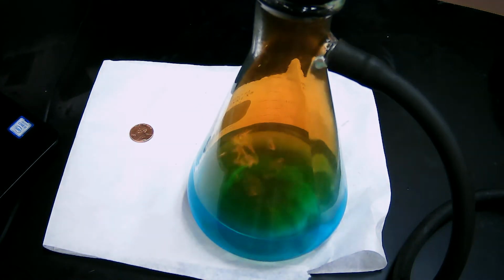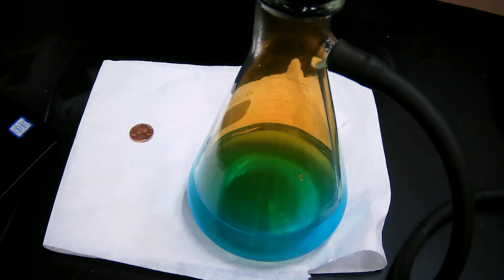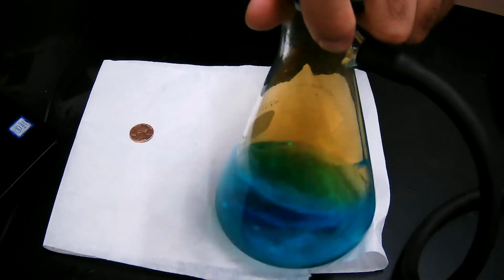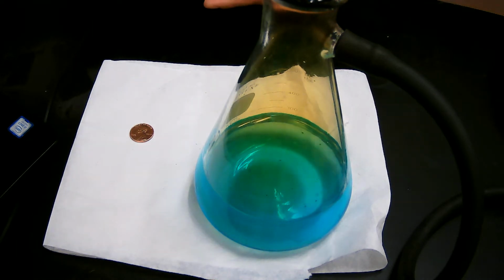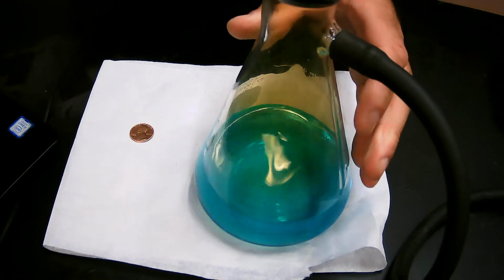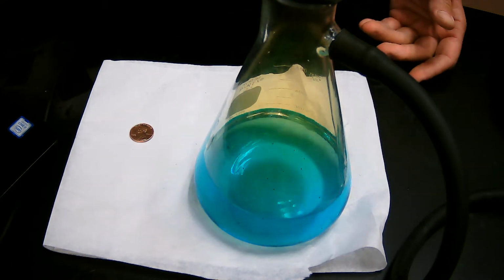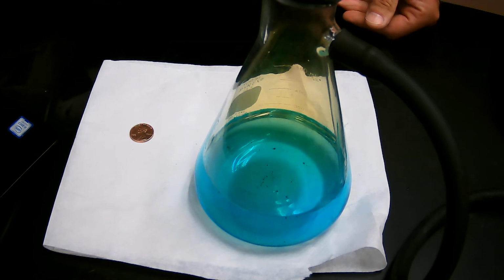After that, he said it was probably one of the most remarkable experiences that he had ever had, because it taught him that you need to be very intentional about the words you use when you describe things like chemical reactions. So these general statements like nitric acid acts upon a penny, we would have never been able to predict what we just saw, which is a penny essentially disappearing into thin air and this liquid that's left. It gave off a ton of heat, it gave off that brown gas, and what we're left with is this very pretty blue solution. There's no way we could have known that. There's no way that Ira Remsen would have known that.